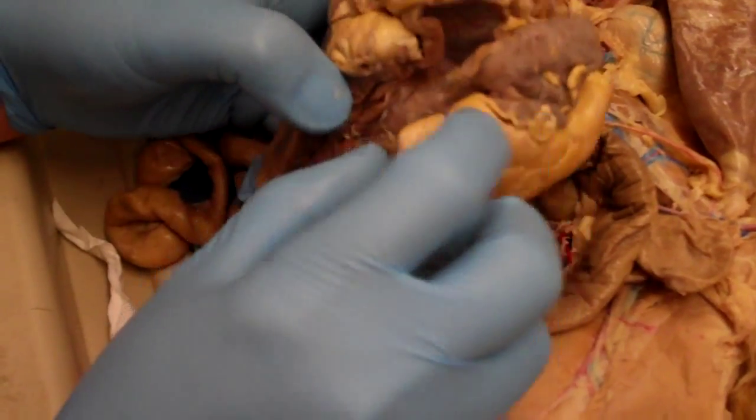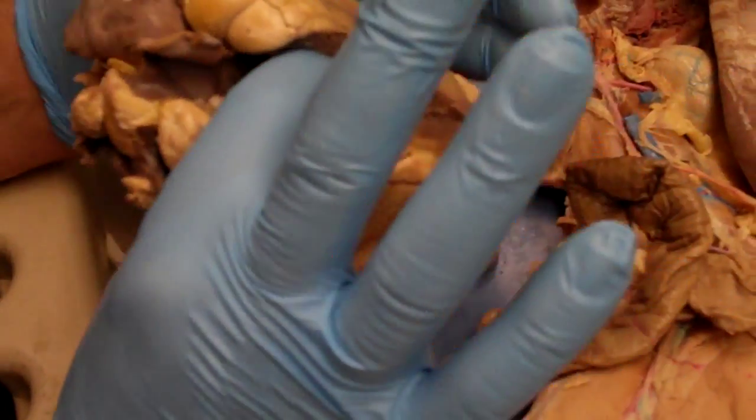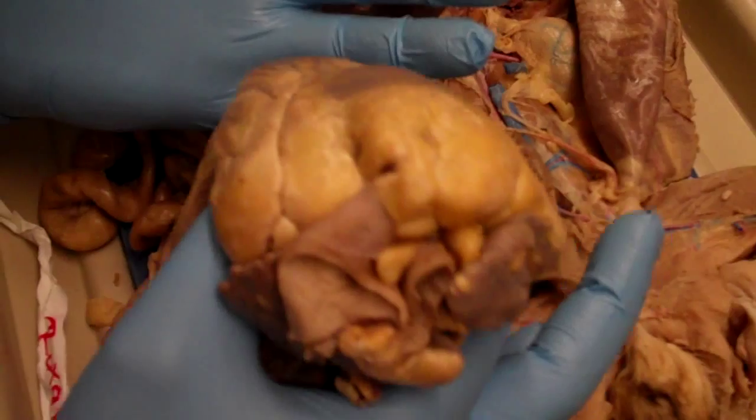It's just much thicker. So if we open up the right ventricle on one side, left ventricle on the other side, squeeze our fingers together, there'll probably be a gap of maybe half an inch between them, and that's going to be the interventricular septum.